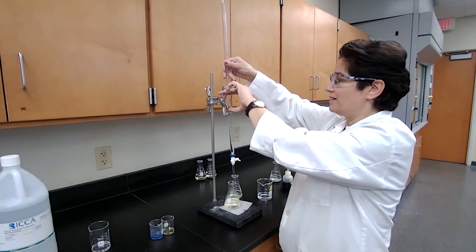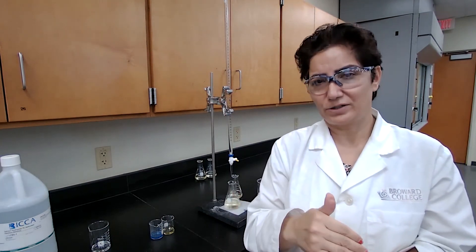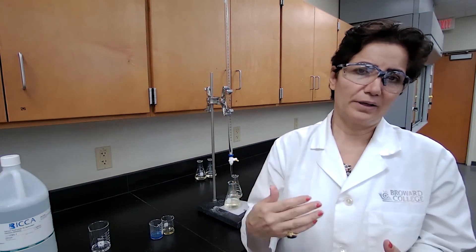So based on the common ion effect, when we added calcium chloride to the calcium hydroxide, the solubility of calcium hydroxide was lowered slightly. It's not a huge difference, but the concentration of calcium chloride that we also used was not very high.